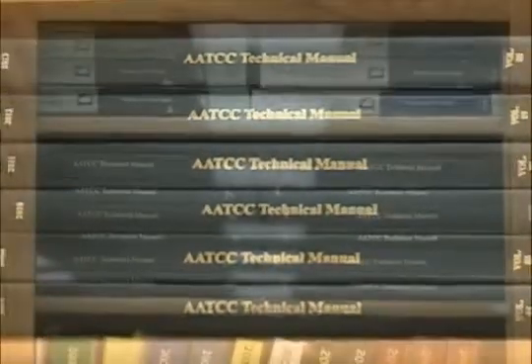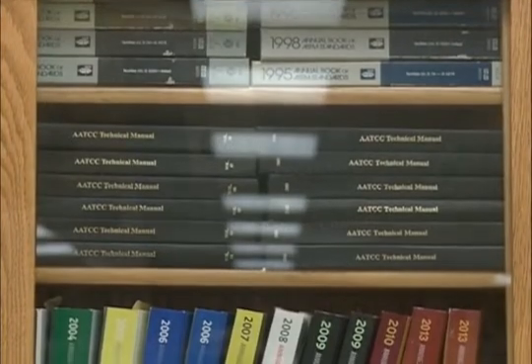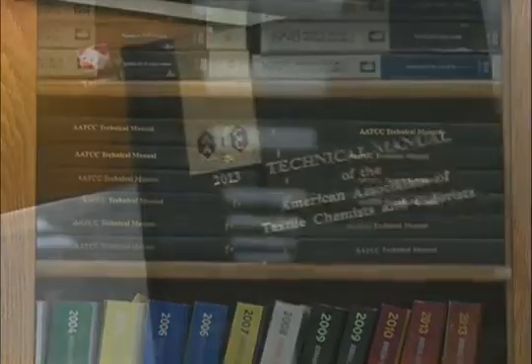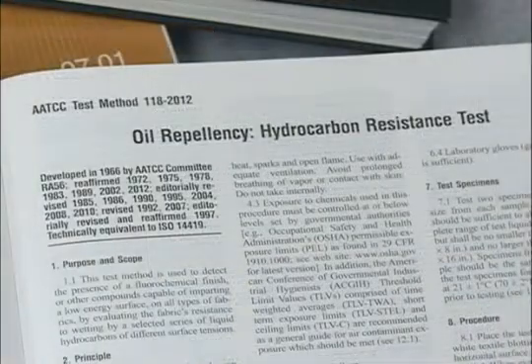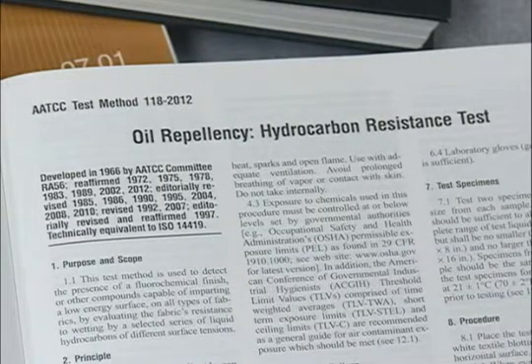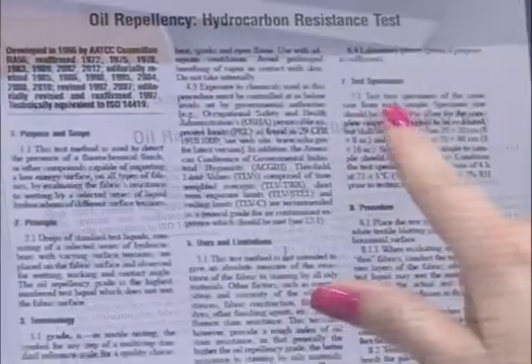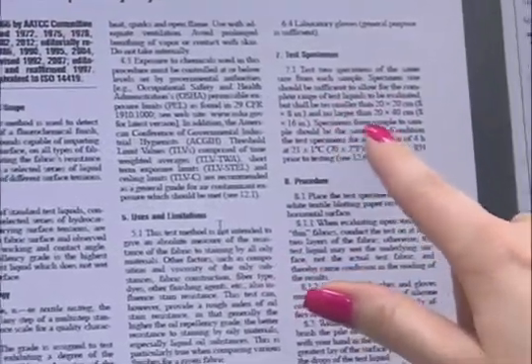The textile industry needed a test to detect the performance of soil release finishes. The test for judging how well a finish performed was developed by AATCC's Committee on Stain Resistance. It's called AATCC Test Method 118, Oil Repellency, Hydrocarbon Resistance. It has been edited, reaffirmed, and used since 1966.